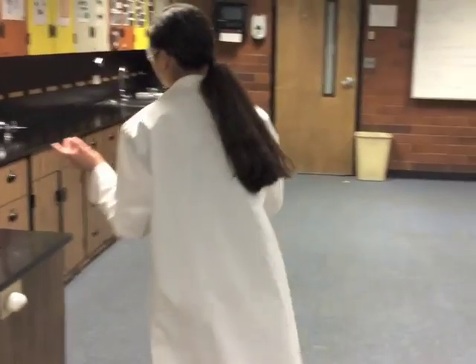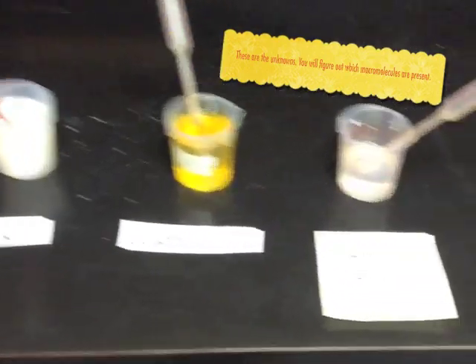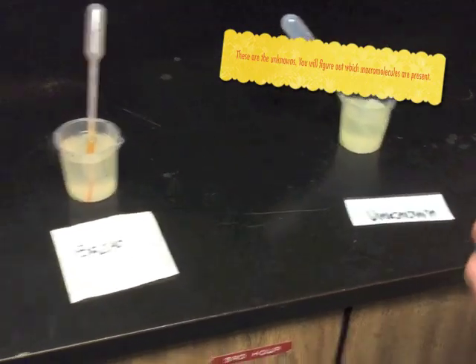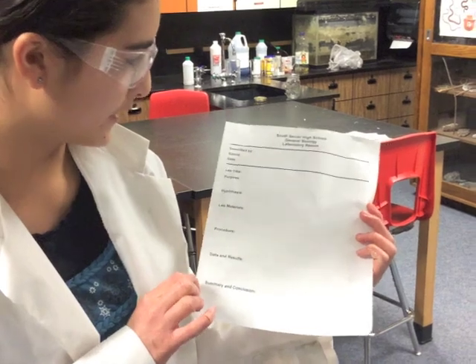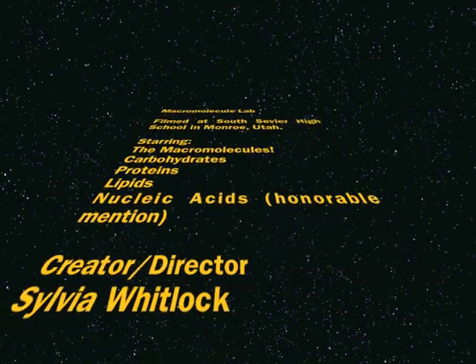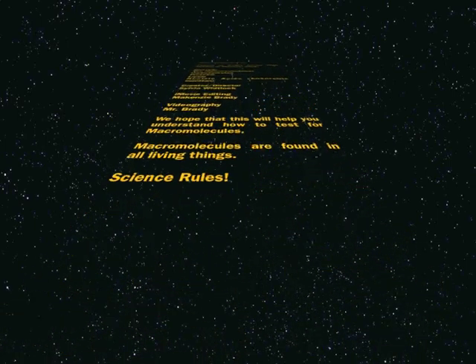Once you're done with the known samples, you will also test known substances such as peanut butter, milk, apple juice, egg whites, potato or corn chips, and bread — and then you'll test an unknown. Use all the different tests on them to figure out which macromolecule is most present. Don't forget to fill out your laboratory report completely and clean up the supplies and put them away.